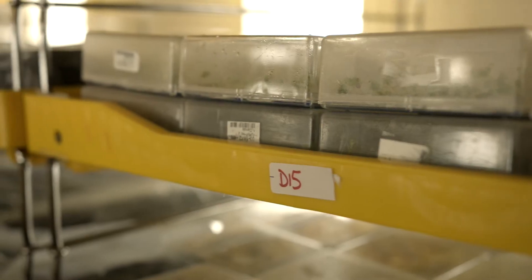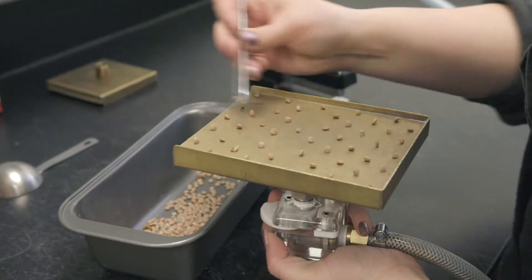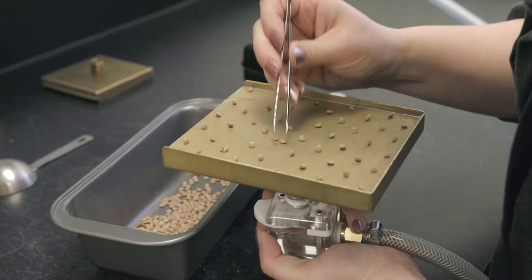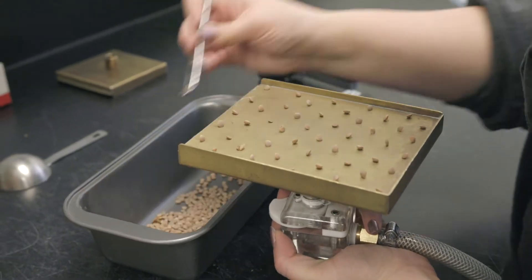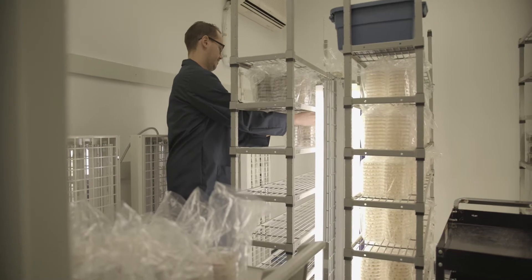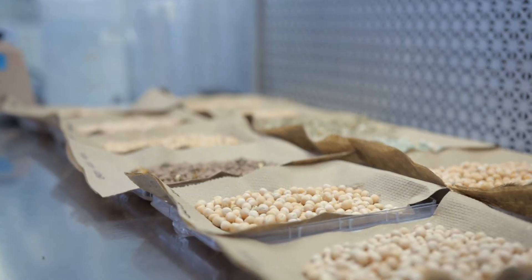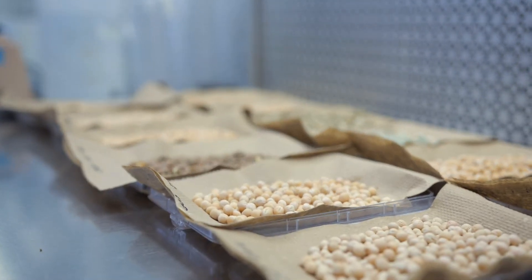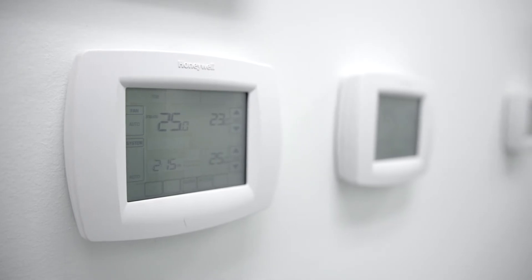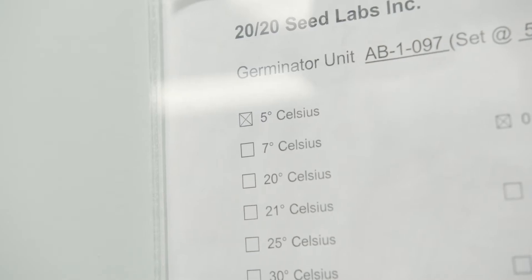Canadian germination requires testing of 200 seeds in ideal conditions in the growth chamber to ensure optimal germination, as there is no stress imposed on the seed. All variables such as light, moisture, and temperature are strictly controlled to ensure the only variable is the seed itself.